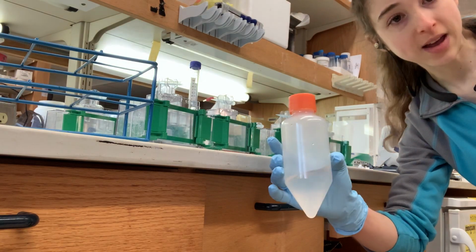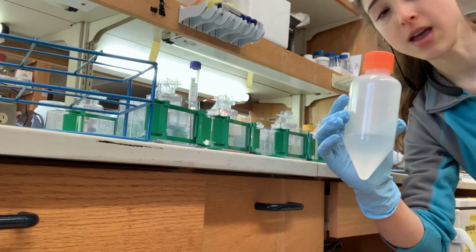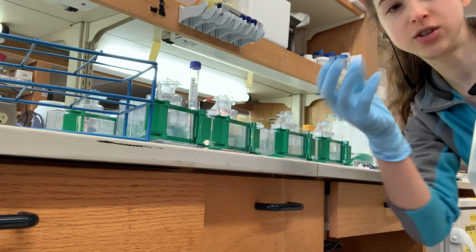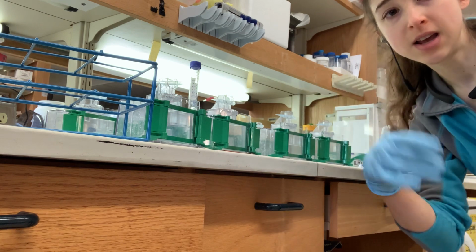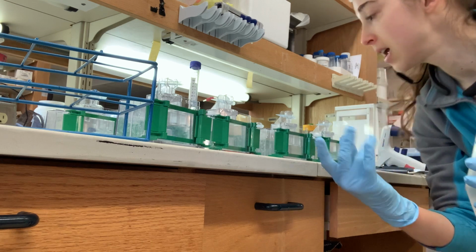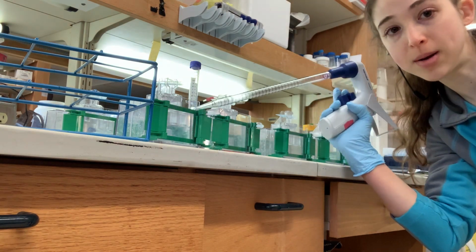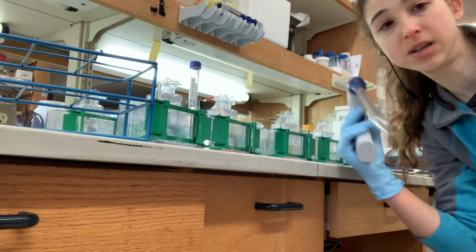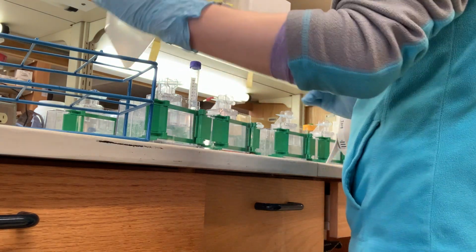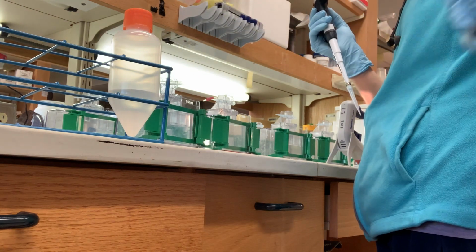I'm going to add the APS and the TEMED, and that's going to start the polymerization. And then it's go time. After I add, I shake a little gently, or rock a little, so you don't get bubbles. Then I'm going to pipette in the liquid up to about the line, leaving room for the stacking gel, because this is the running or resolving mix. So I've got a 10% APS solution.